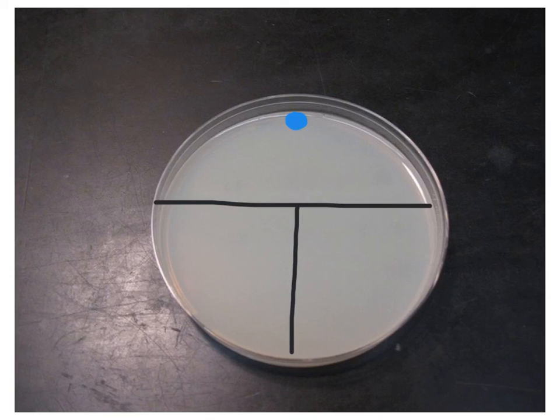Once I have done this, I'm going to take my flame loop and run it across like this right here so that I can pick up this bacteria, this mass. I'm going to take it and move it across all like this, spreading it out and diluting it as I move from the top of the plate to midway down. I just go back and forth.